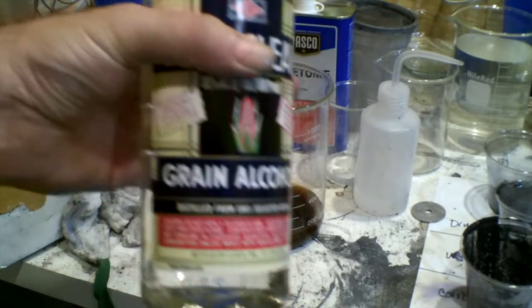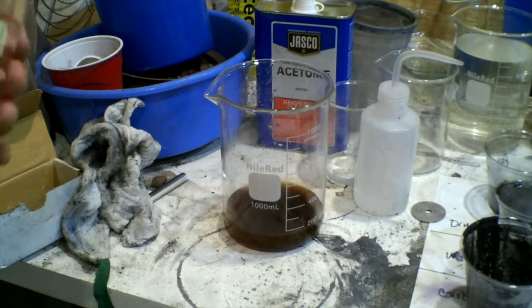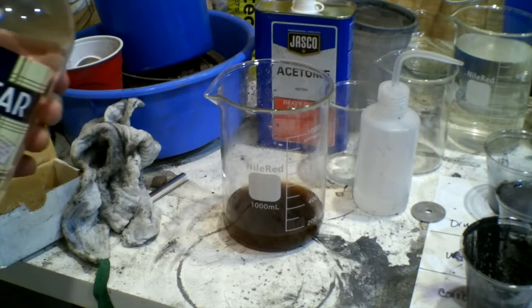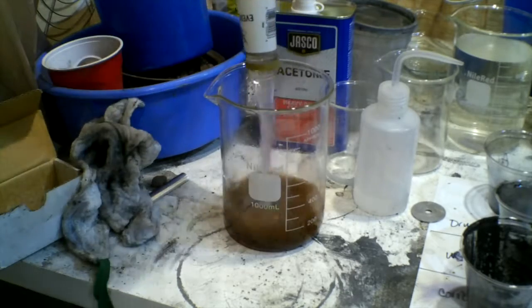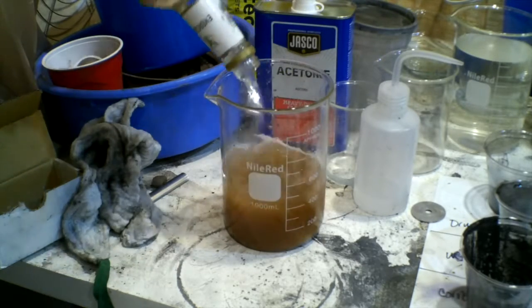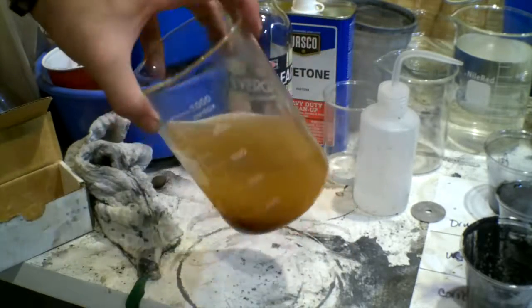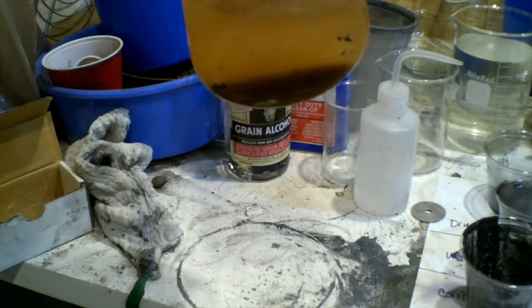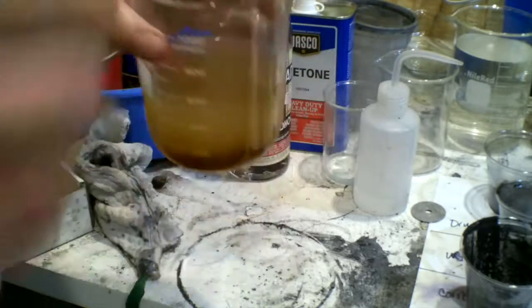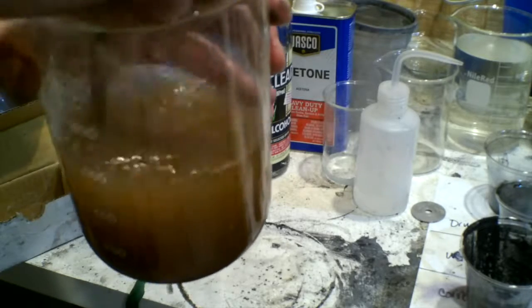So I'm going to try ethanol. This is actually only about 95% ethanol — it's going to affect my yield. But I still want to see if I can turn my stuff white instead of brown. It did it again — it won't mix with that concentrated potassium solution. Down there on the bottom — it's very dark brown. It's just a weird, weird reaction.